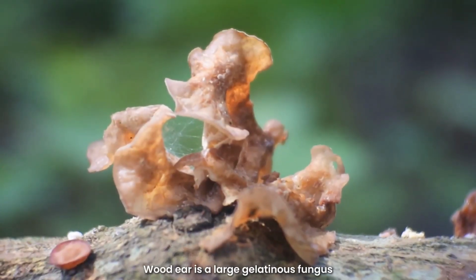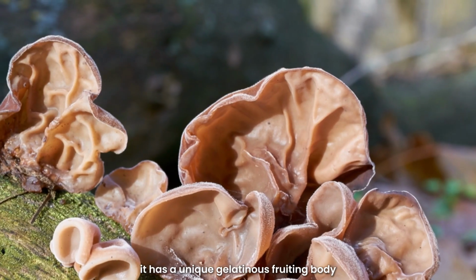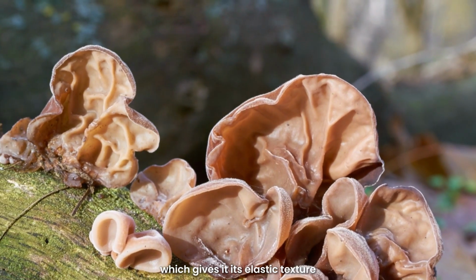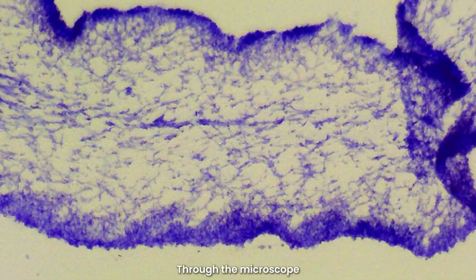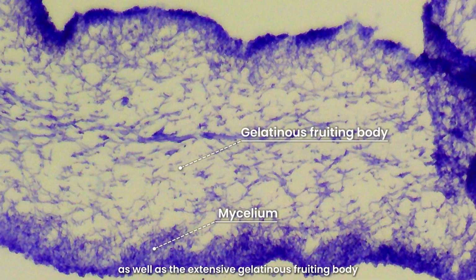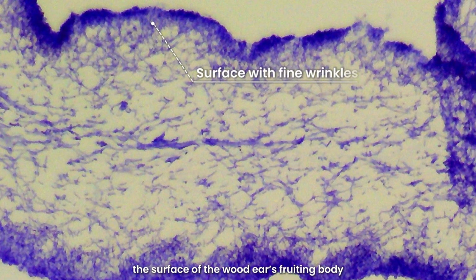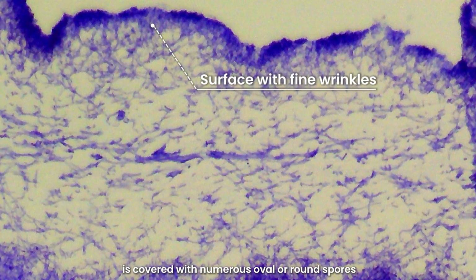Wood ear is a large gelatinous fungus, and unlike mushrooms, it has a unique gelatinous fruiting body, which gives it its elastic texture. Through the microscope, we can observe the mycelium of the wood ear as well as the extensive gelatinous fruiting body. Like mushrooms, the surface of the wood ear's fruiting body is covered with numerous oval or round spores.